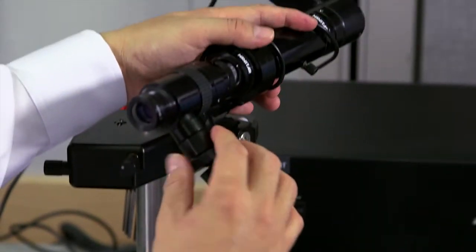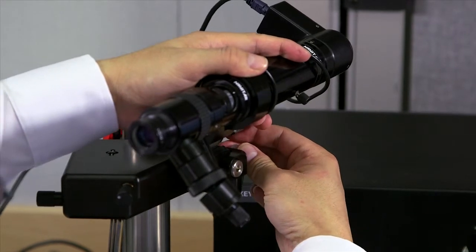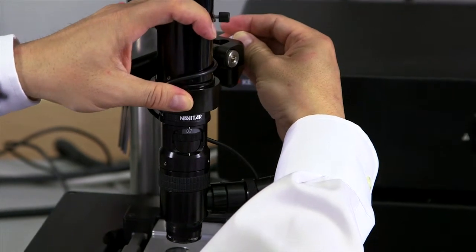Let's swing down the optical microscope by pulling the lever behind the assembly and then swing the optical microscope to position.